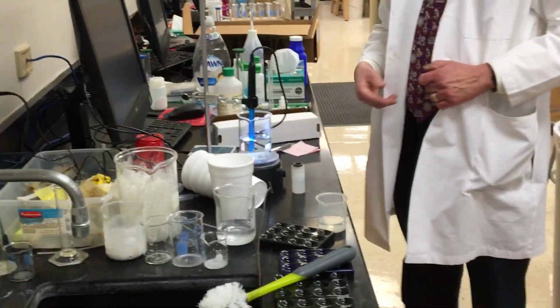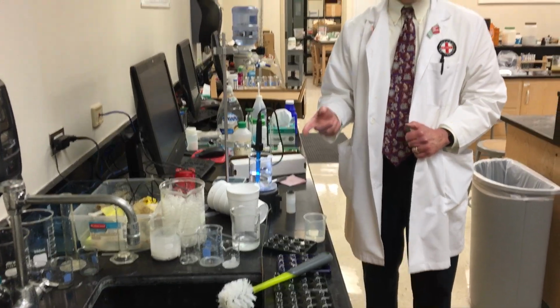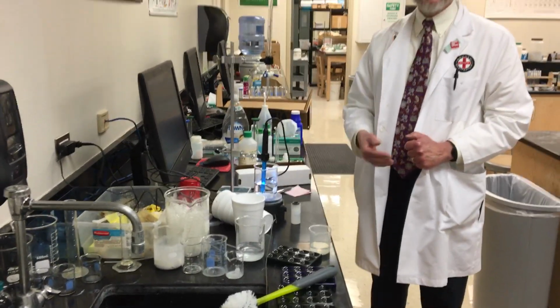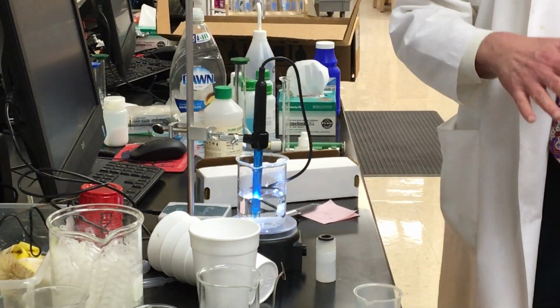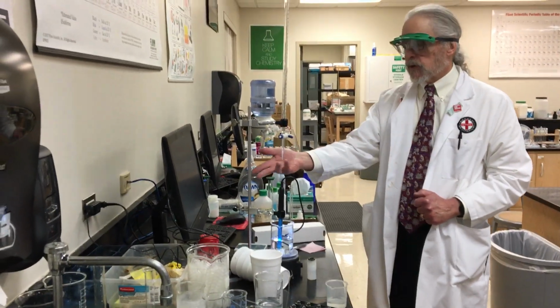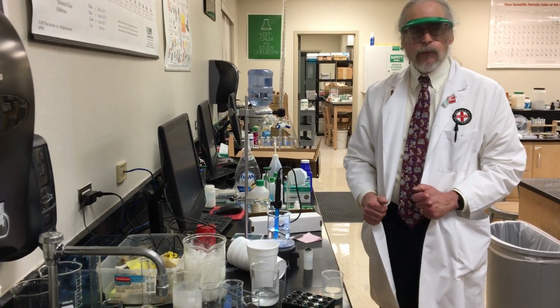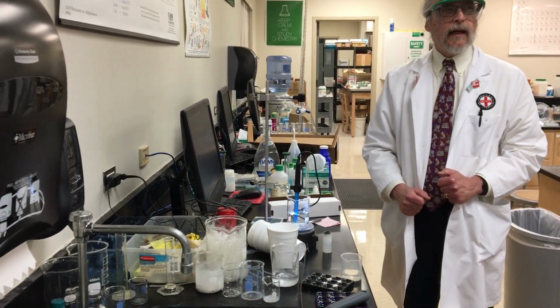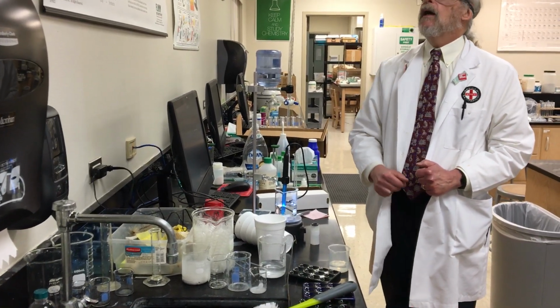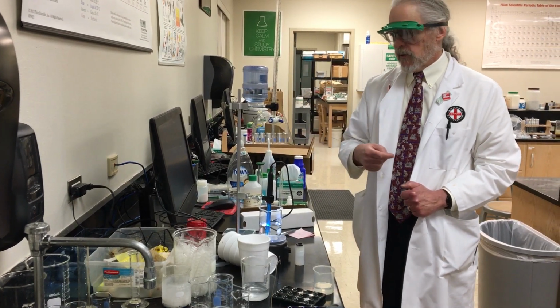So I'm saying that there should be about 0.066 molar HCl based on the pH. pH is not super accurate, folks. It just isn't, okay? This is measuring it to 3 sig figs. I would not trust it, but I would use it to kind of figure out where I was. What I'm going to do instead is add a base to this.